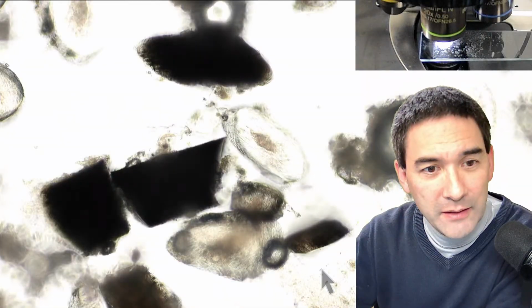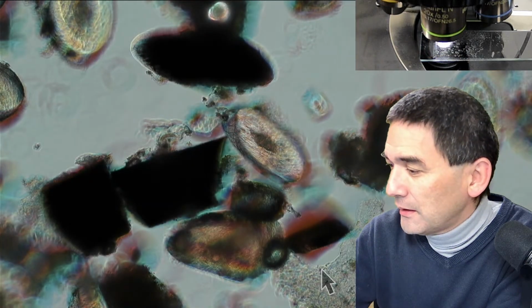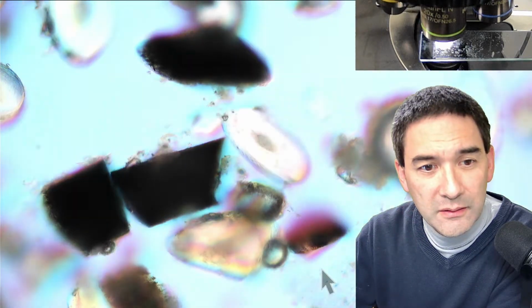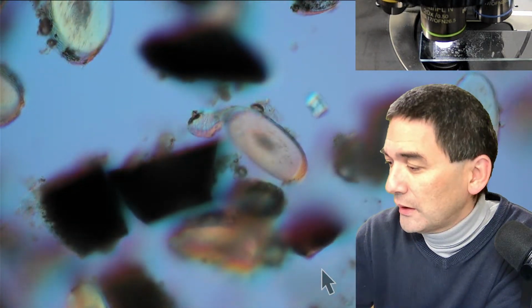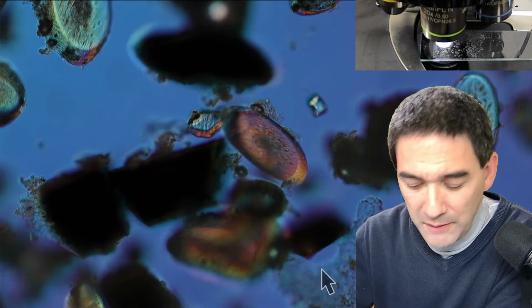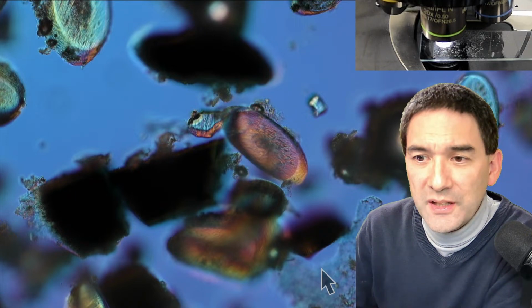I don't know if some of my students actually joined in. I told them that I have a live stream today. And the reason is because thankfully some of my students donated some hair. And let me adjust this again. I would like to show it to you as well. Today in the morning, from my time at least, I prepared some microscope slides with those hair. And I consider them quite interesting as well.